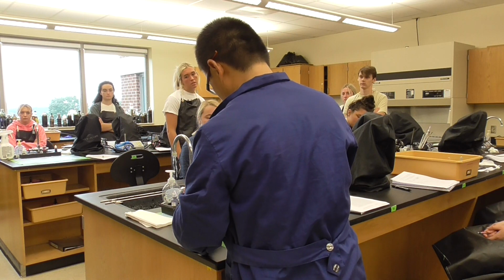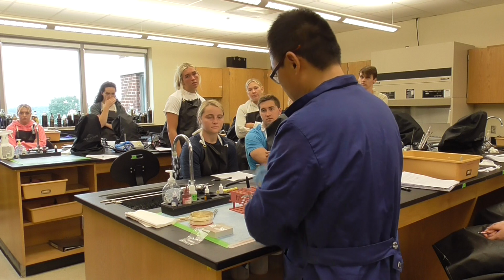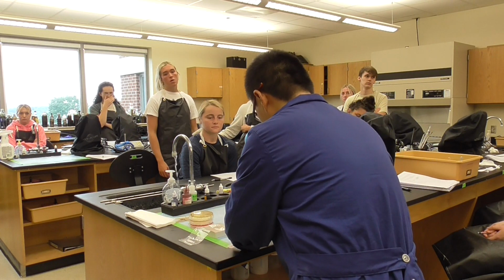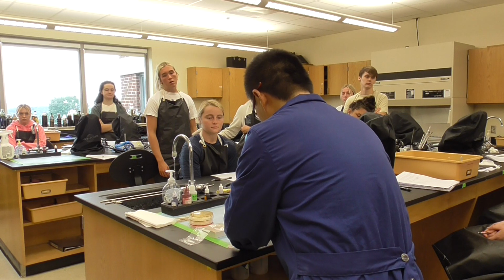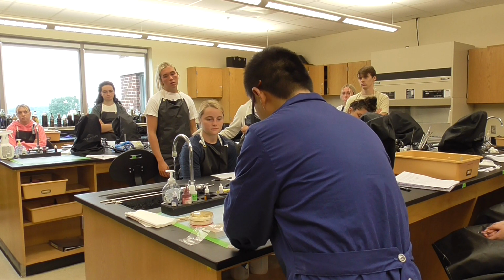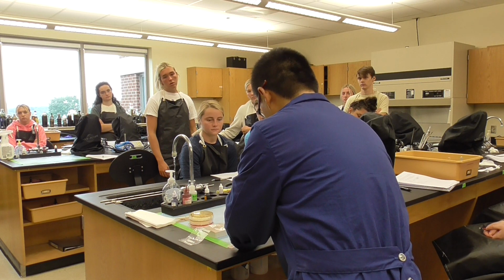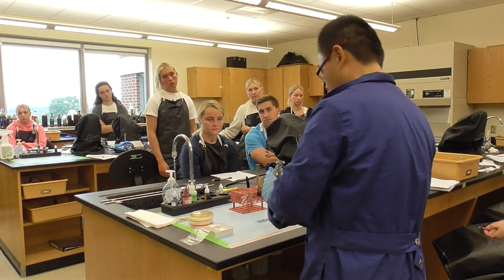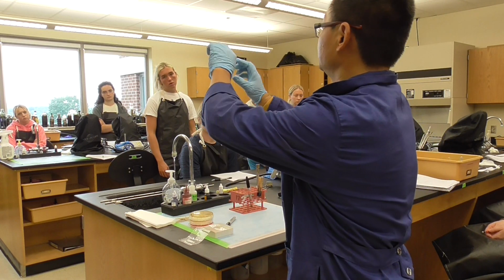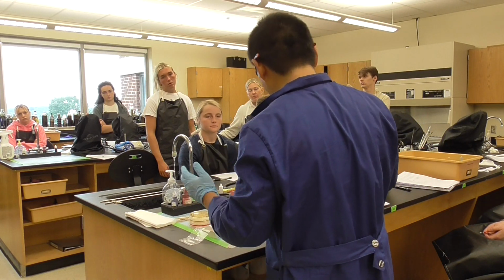And then you have a glass slide. Just take a glass slide. Okay. So on the glass slide, we're going to draw 3 circles. So it's 1, 2, 3. We'll label E. coli, Staphylococcus aureus, and also the LF. And once you label it, do not forget to flip it over, because the marker could damage the dye.